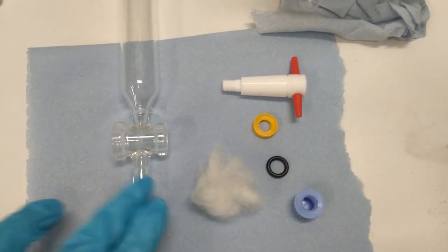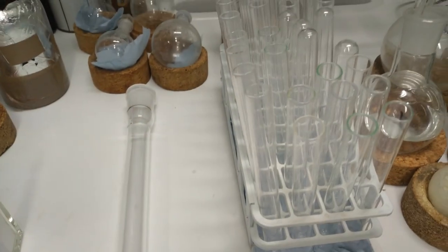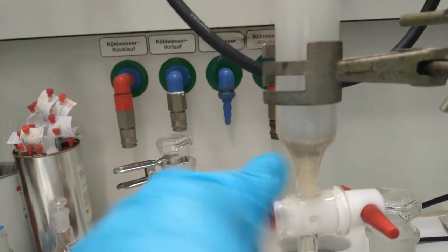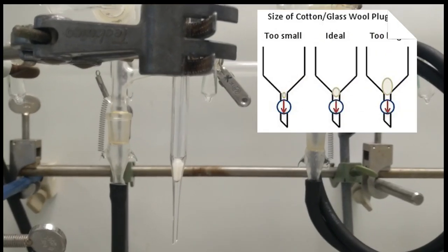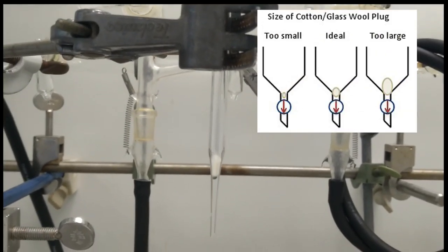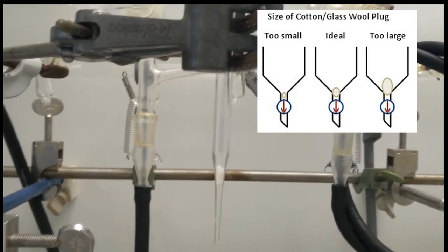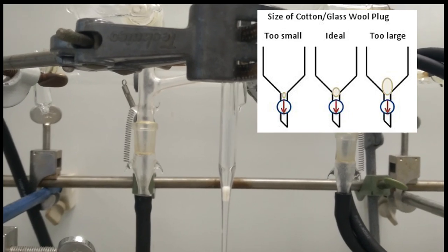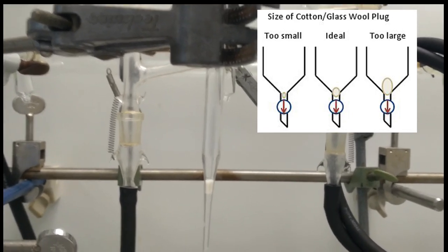We are ready with our column, cotton, screw, and a rack of test tubes. The very first thing which we require is this cotton to close the nozzle like this. We need to take sufficient amount of cotton as shown in picture also, and press tightly with the help of glass rod to close the opening of nozzle.